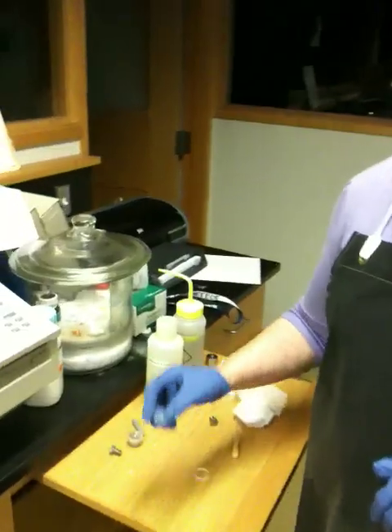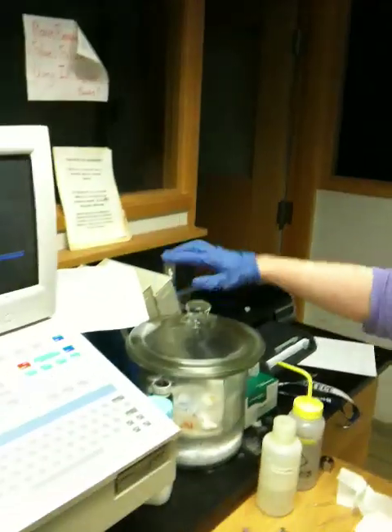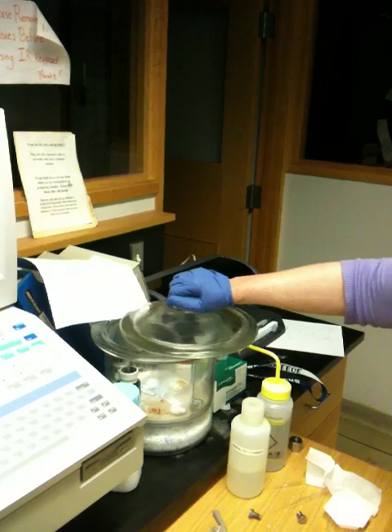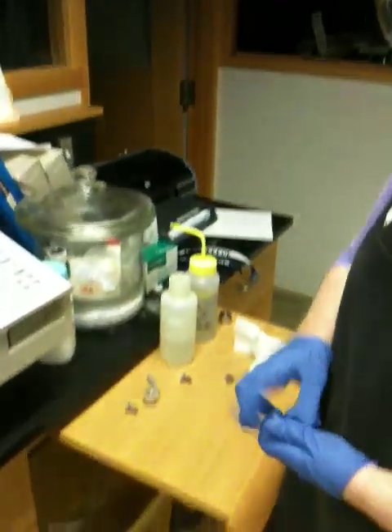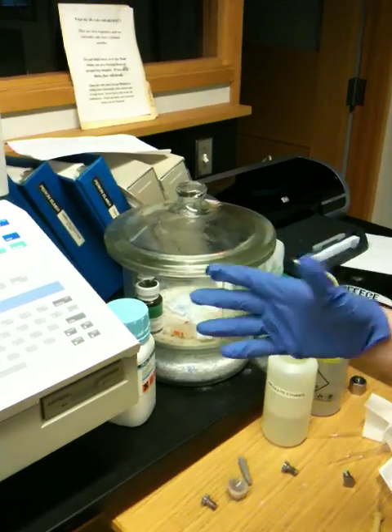I'm going to show you how to make three different samples in probably three to four different films because it takes a little bit of time. The first type of sample I'm going to show you how to make is a solid film — you will be making solid films this week. What you're going to need is a sodium chloride disc. You will be able to find all IR equipment in the desiccators sitting on each side of the instrument. To open a desiccator, all you have to do is slide back the lid — be careful though, because if you drop it, it's a very expensive piece. There's drying agent in there and the atmosphere is desiccated, meaning very low water.